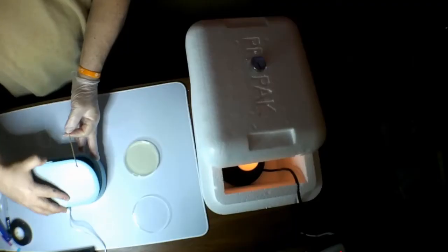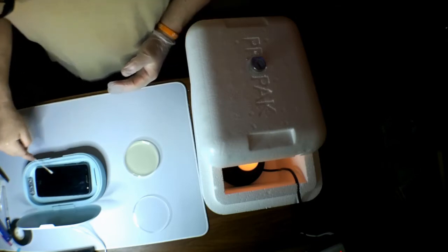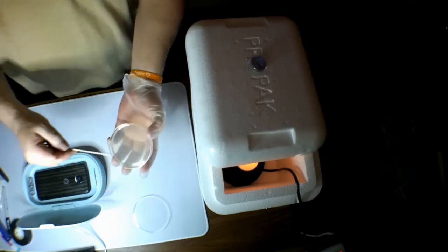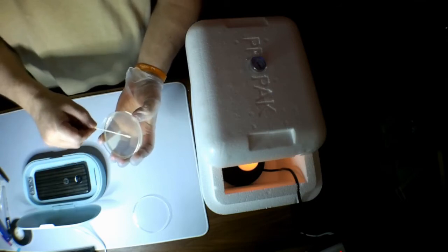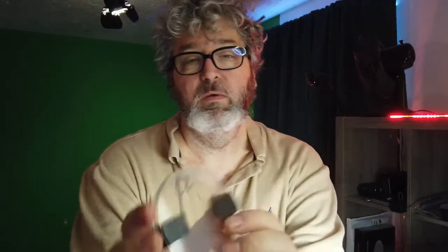We have our petri dish. We're going to open this up. In theory, this is clean. So, moistened with sterile water. Okay, clean hand. Flipping it over. Okay, let's run the agar. Okay. C2 is complete. Now, we can touch the phone. C2. Let's put this in.